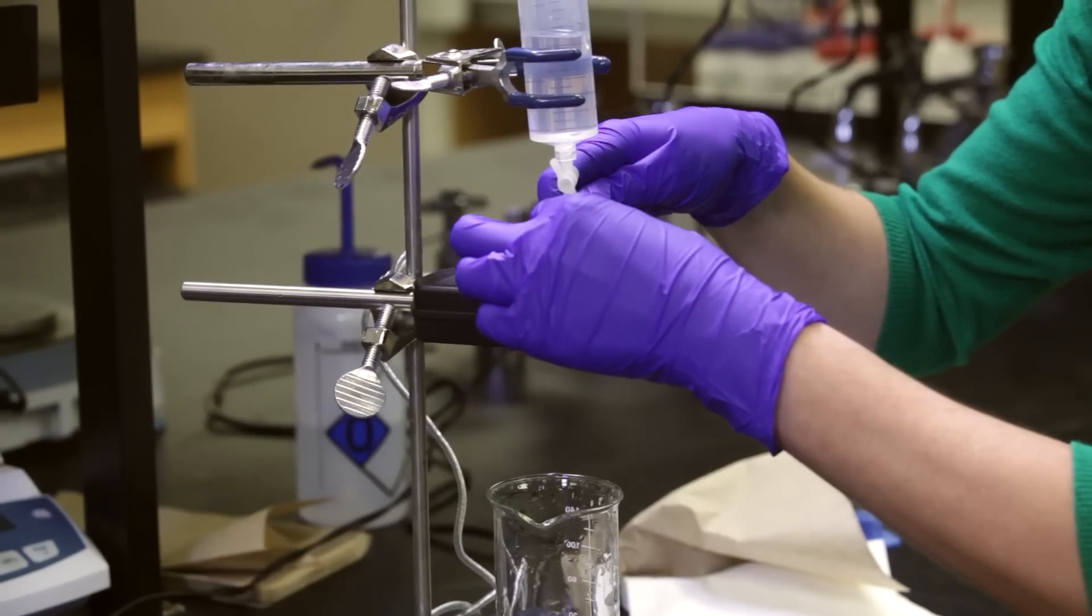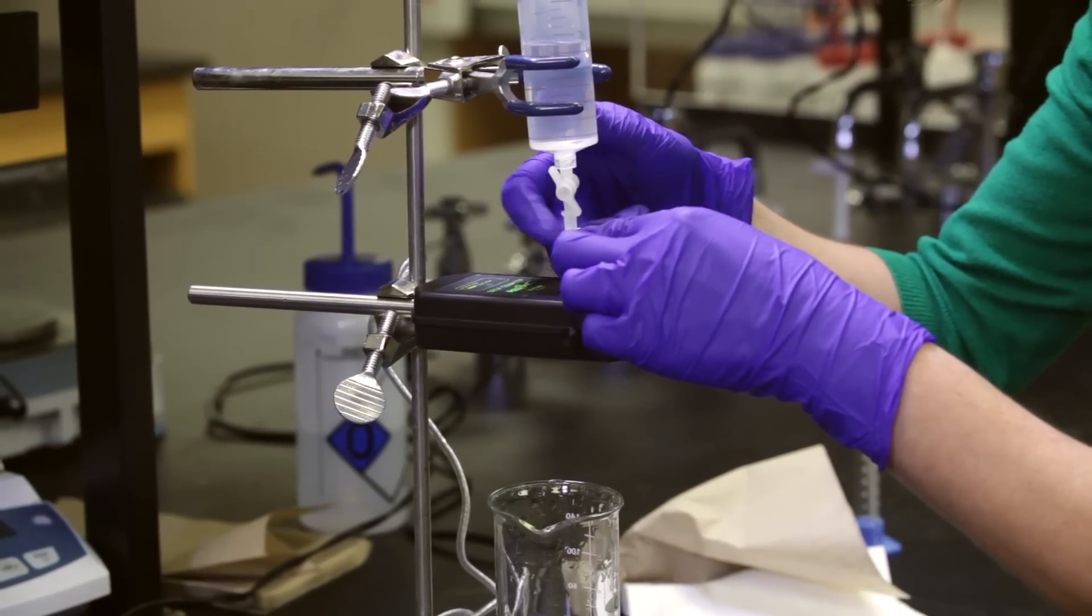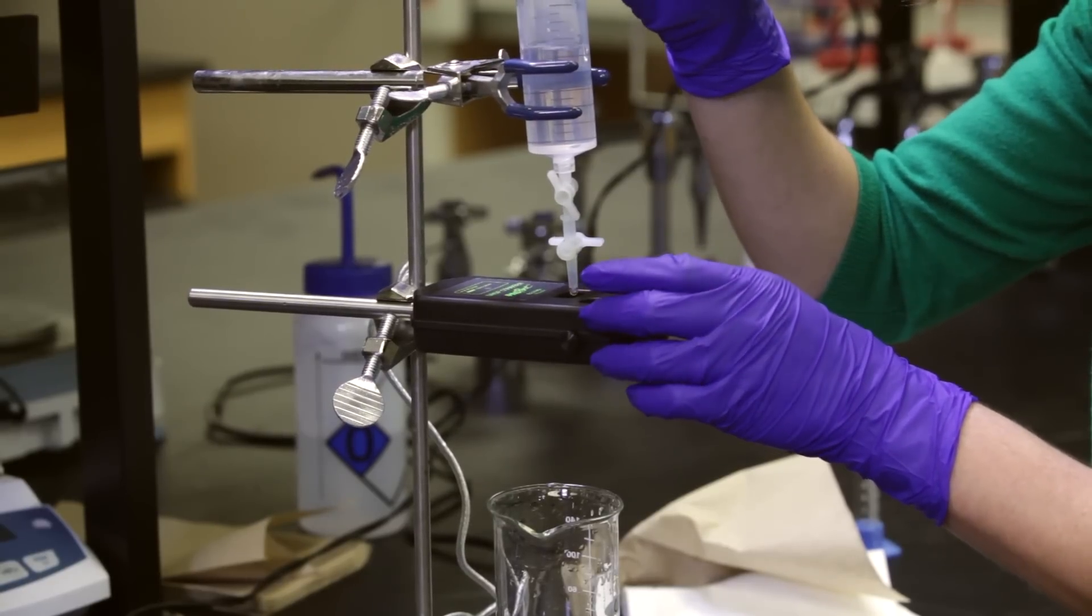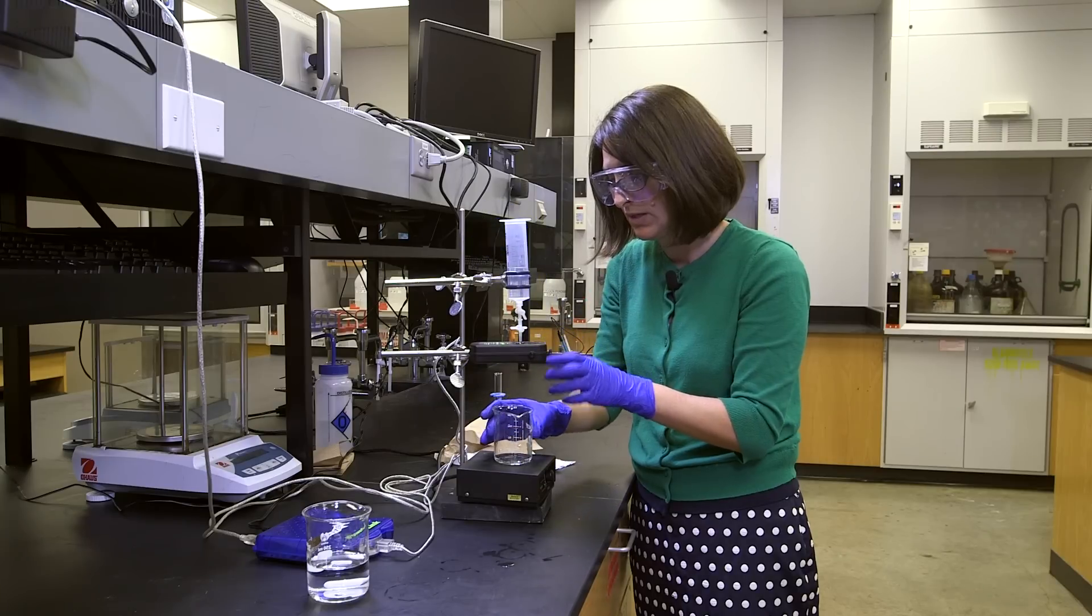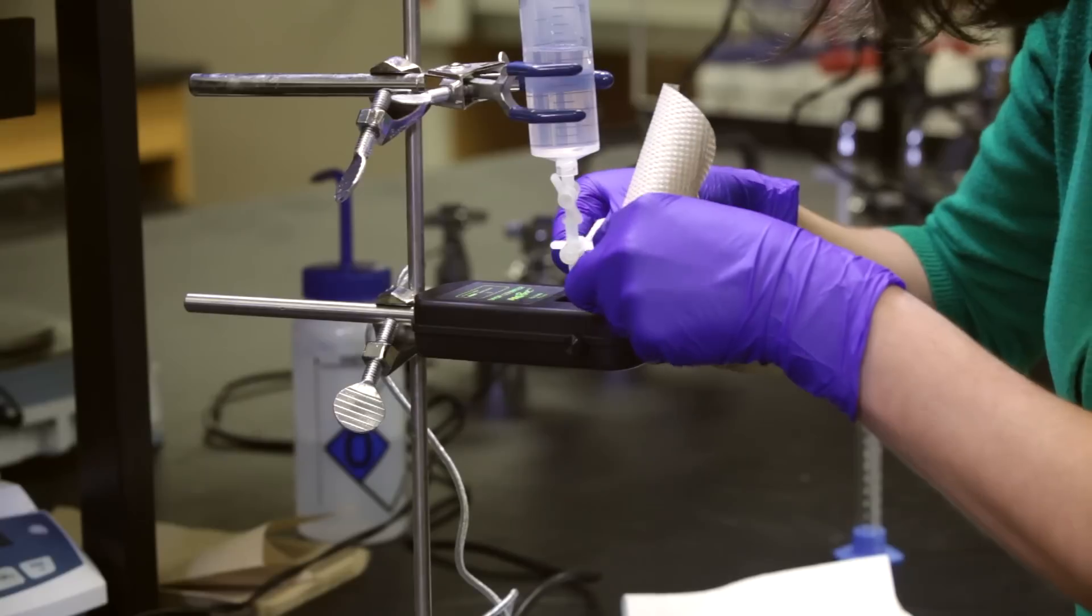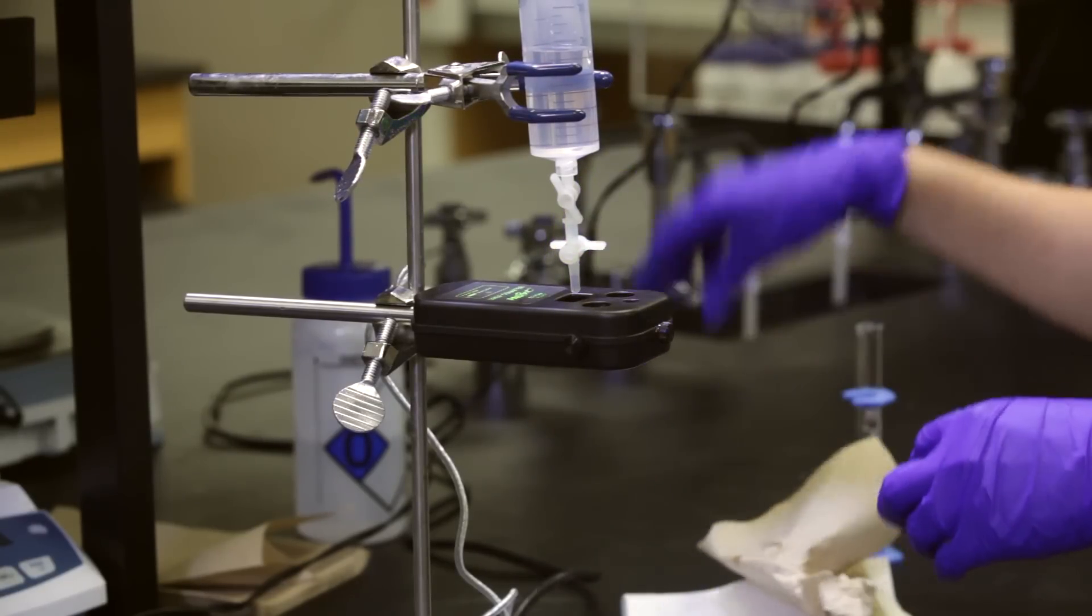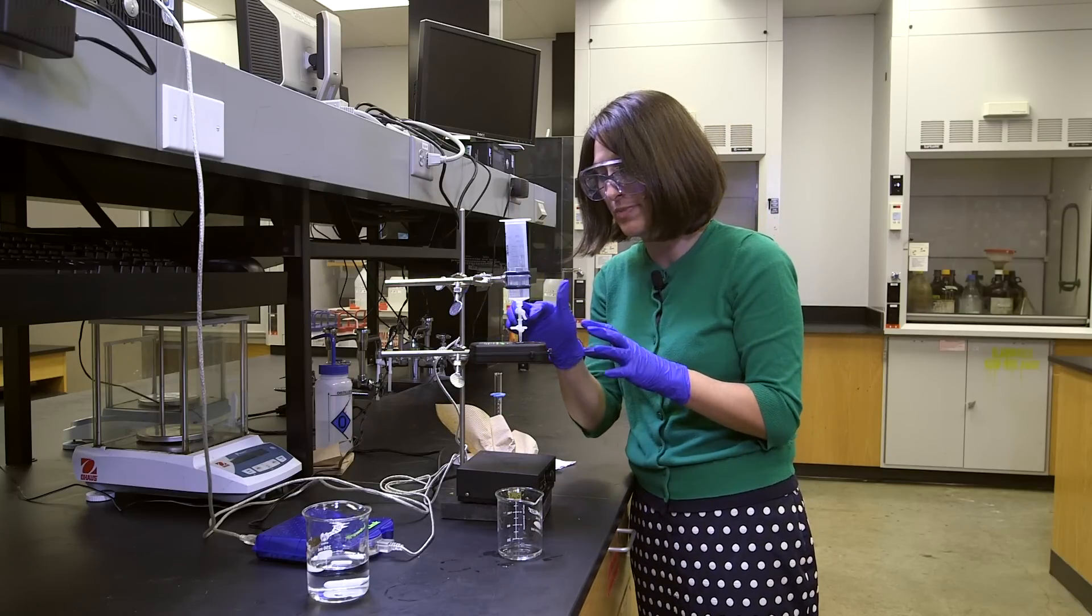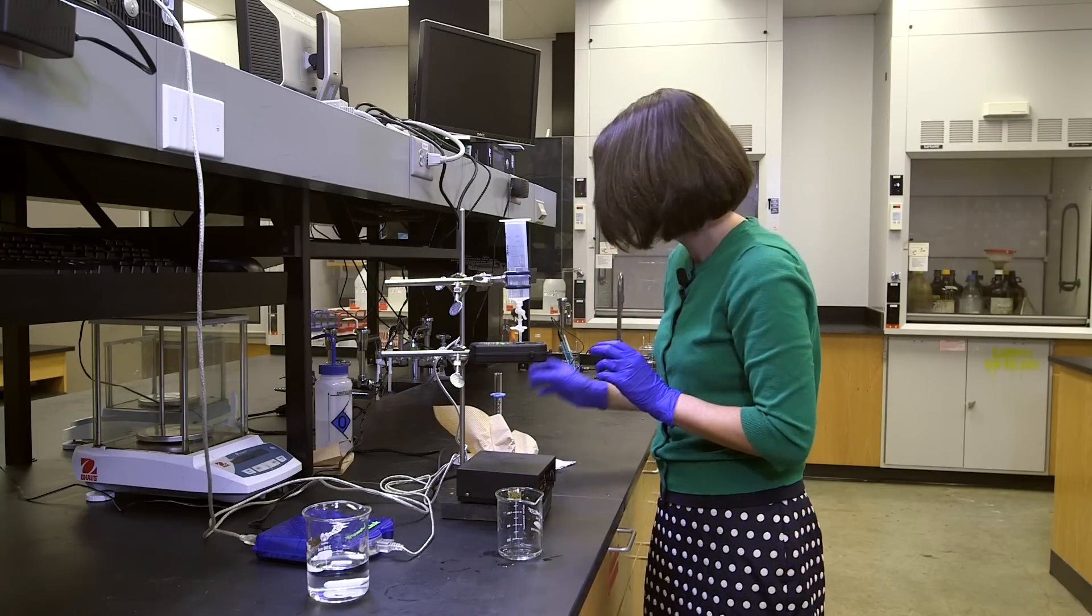I'm going to close just the bottom and there's a stubborn drip on there. Okay. All right, and I know I didn't just leave some paper towel residue or splash because I don't have a green light on.